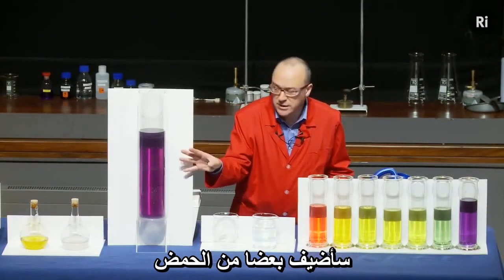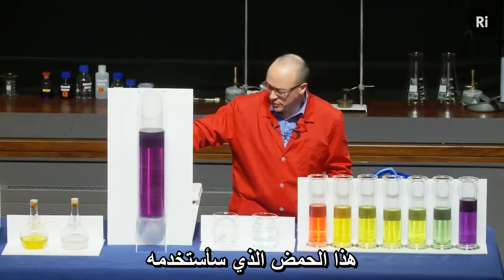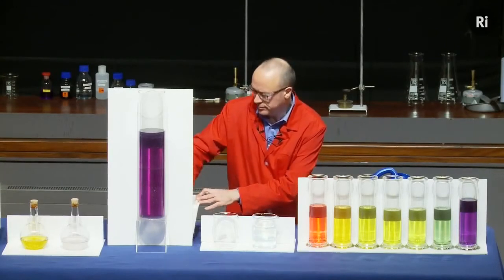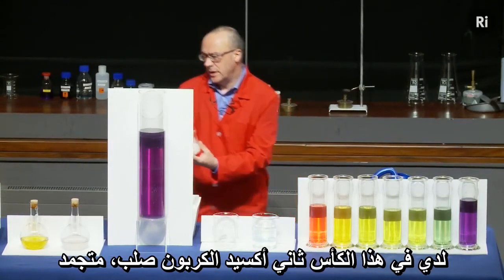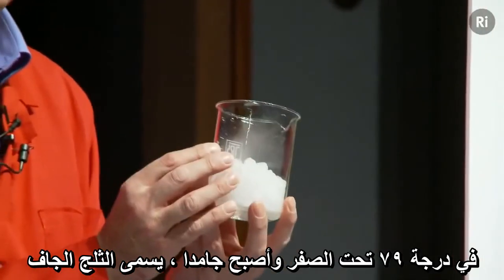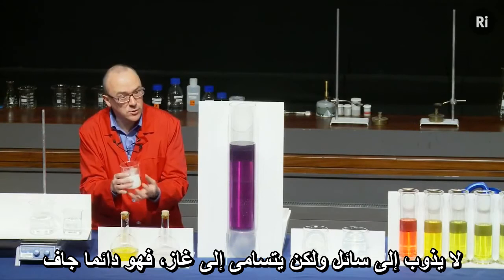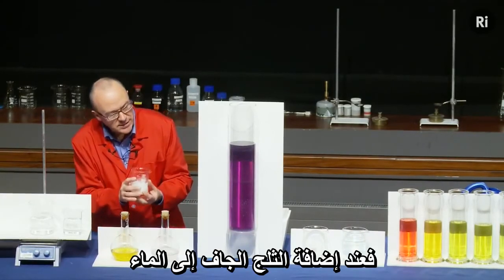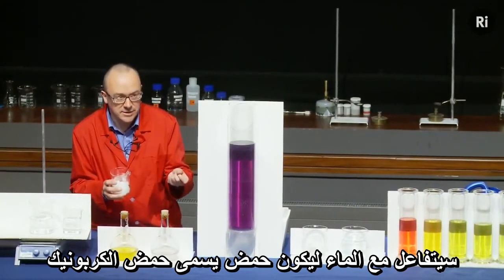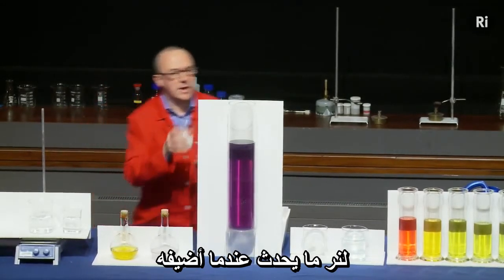I'm going to add some acid and we should see it go through a sequence of colours. The particular acid I'm going to use will be made in the water from carbon dioxide. In this beaker I have carbon dioxide but it's frozen — it's at minus 79 degrees centigrade and it's become a solid. We call this dry ice because when it warms up, it doesn't melt to a liquid; it goes straight to a gas, so it's always dry. When I add the dry ice to the water, it will react to form carbonic acid — the same stuff that's in fizzy drinks, which gives them their fizz.